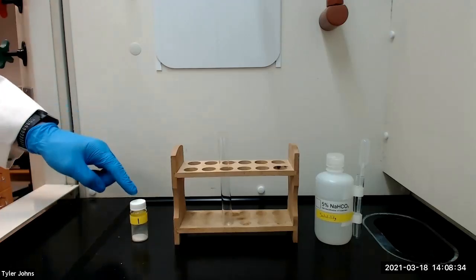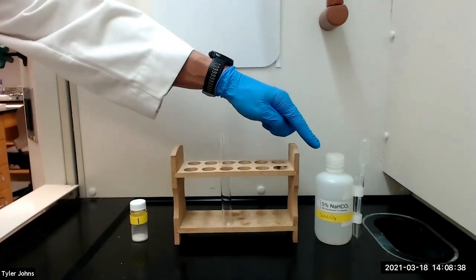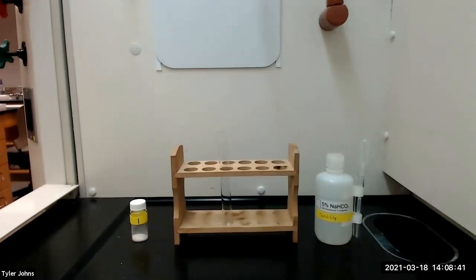We will next dissolve a small amount of unknown number one in a five percent aqueous sodium bicarbonate solution and observe the solution carefully.